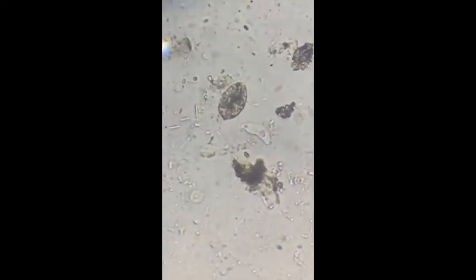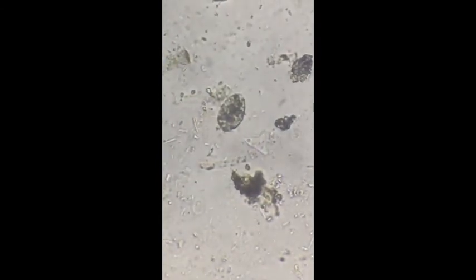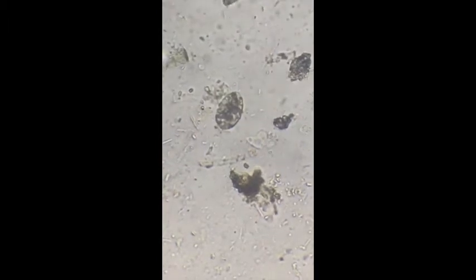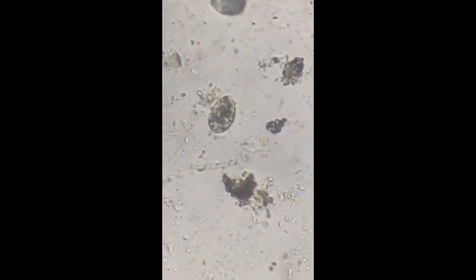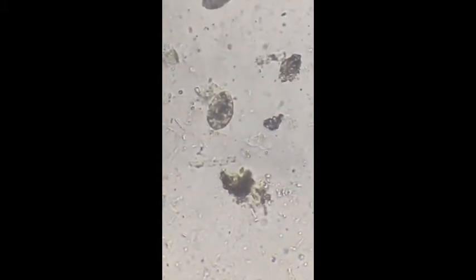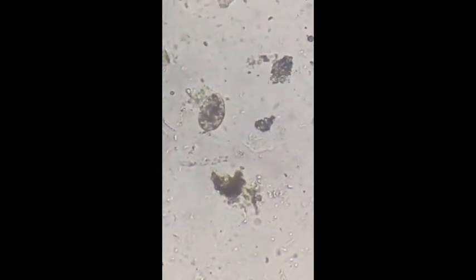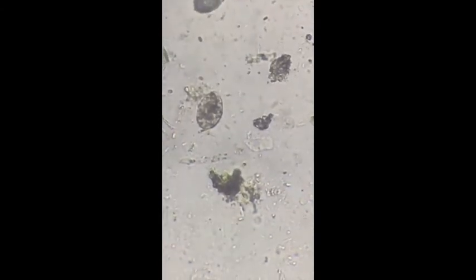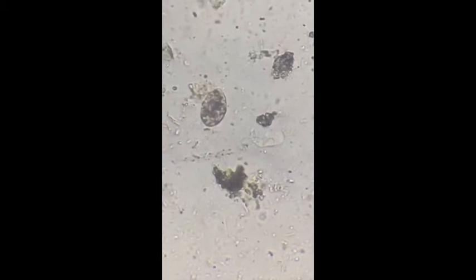In this frame you can see several microorganisms. You can see oval rotifers, several rod-shaped bacteria and spherical bacteria. At the center you can see a moving amoeba which is constantly changing its shape by protruding its false foot, known as pseudopodia. There are some other protozoans also in this frame.